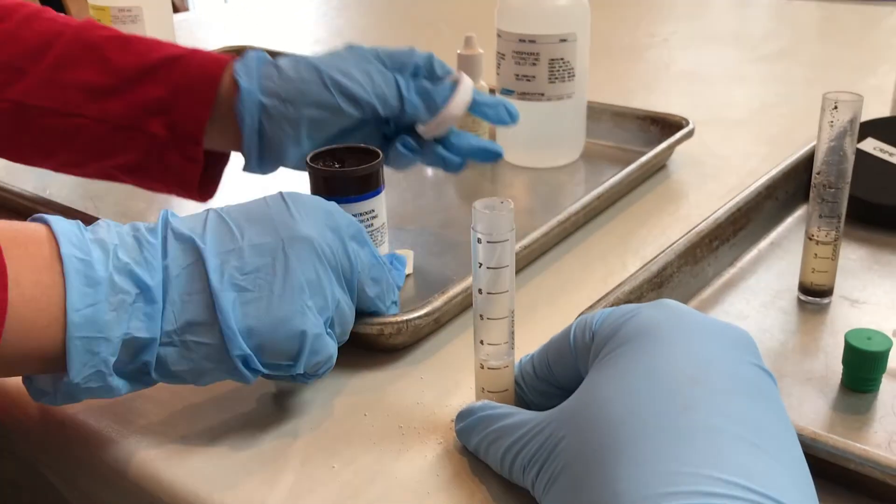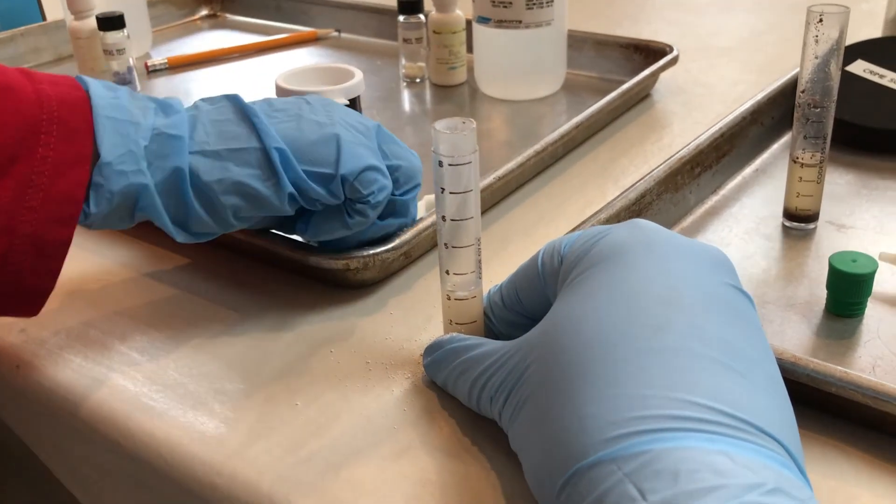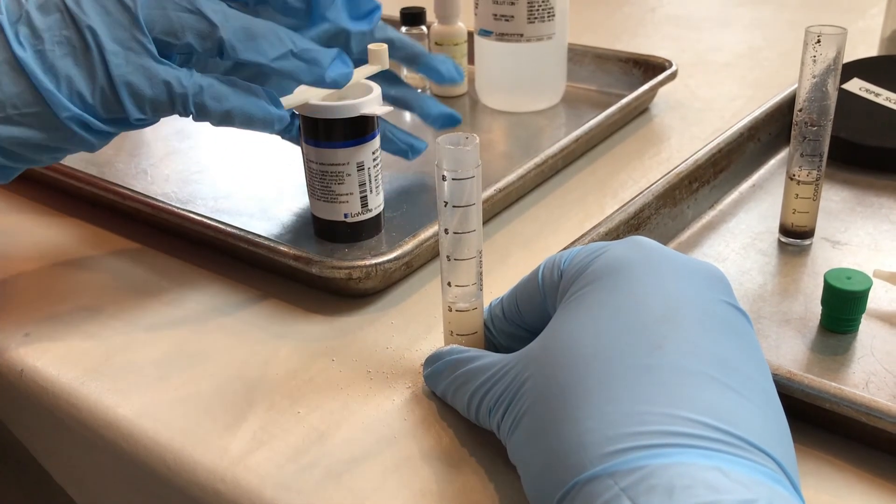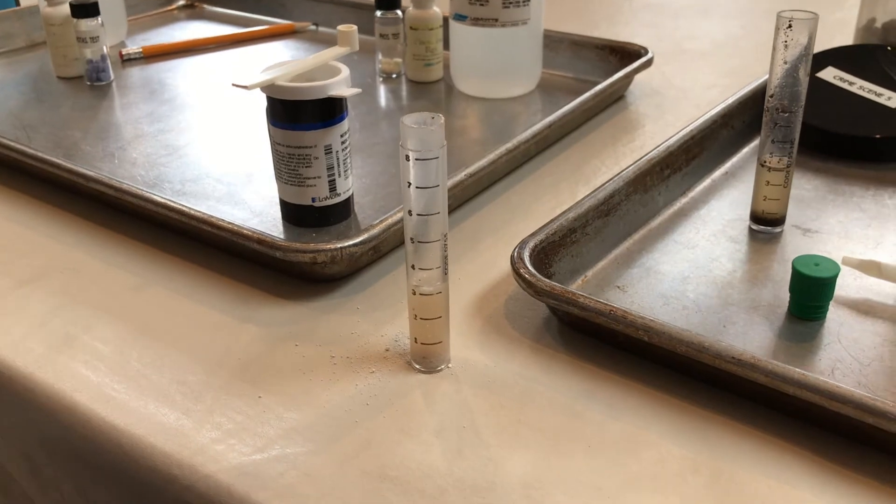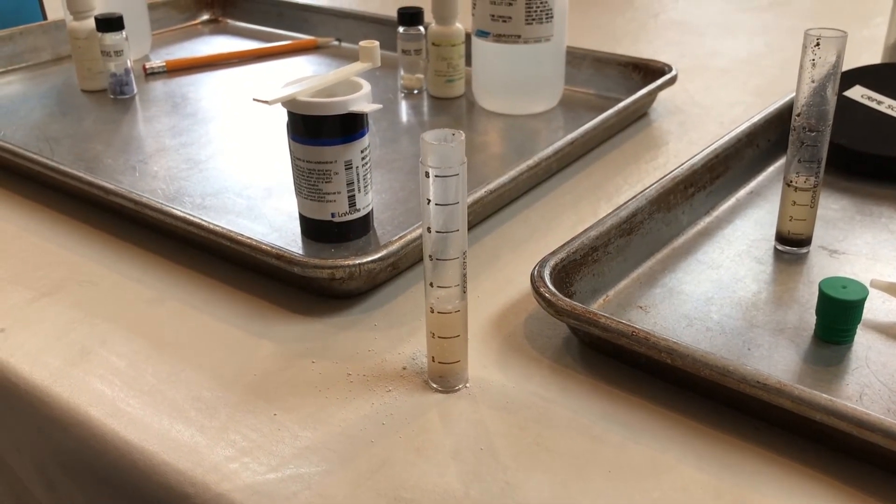Alright, so now all we have to do is cap it and shake it for three minutes this time, and then we will look for our color change with our indicator reagent, and we'll see you in a couple minutes.